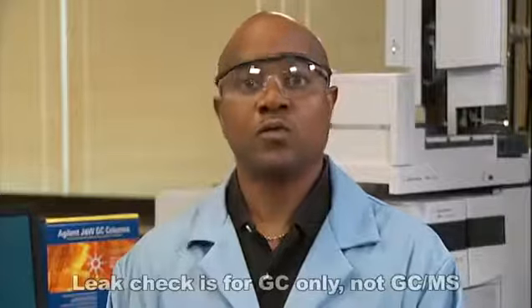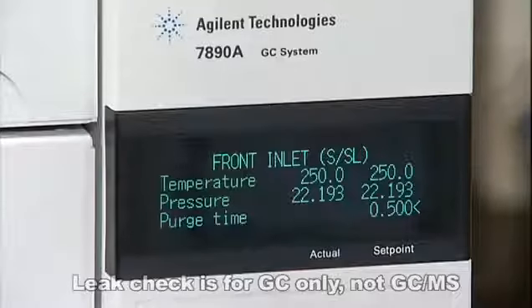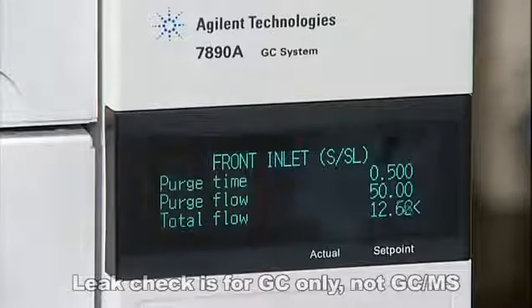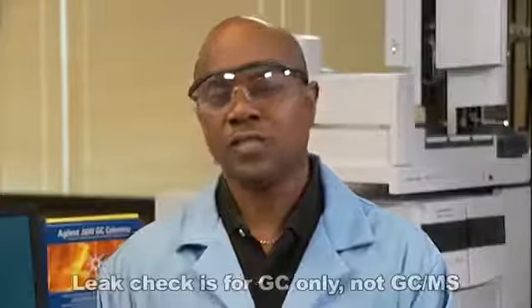Set the purge flow to 50 mils a minute. Next, set your column flow to 7 mils a minute.